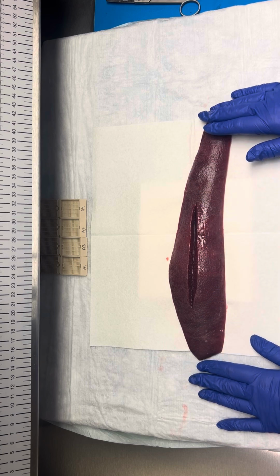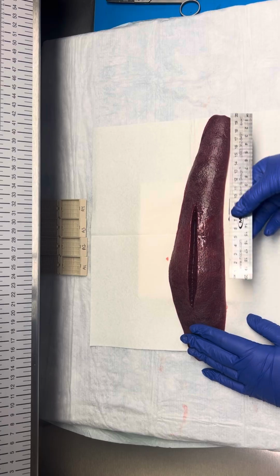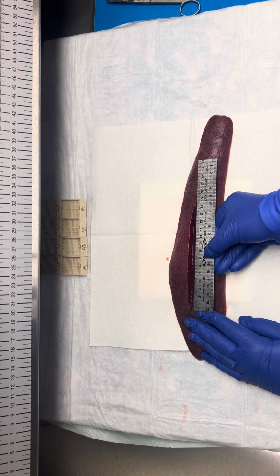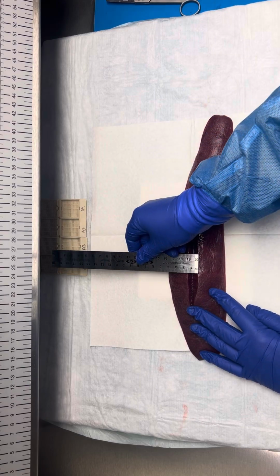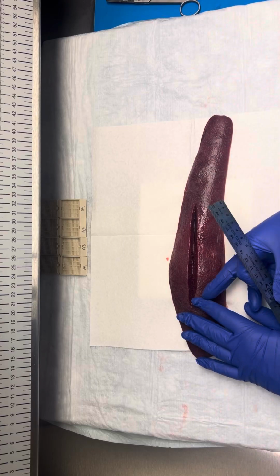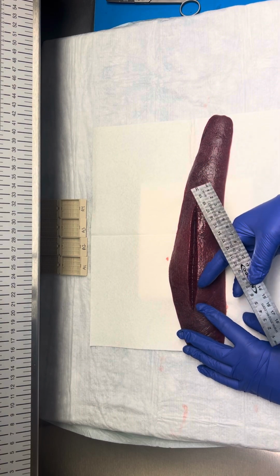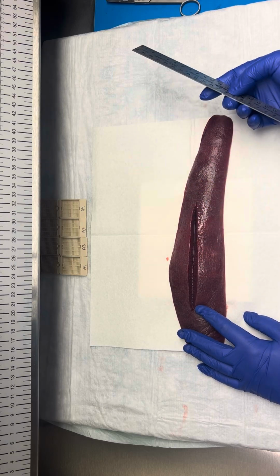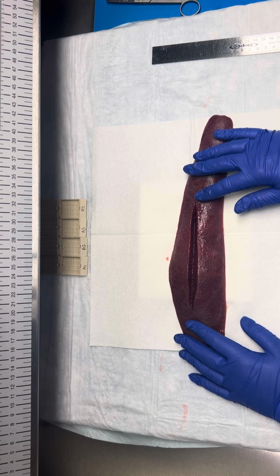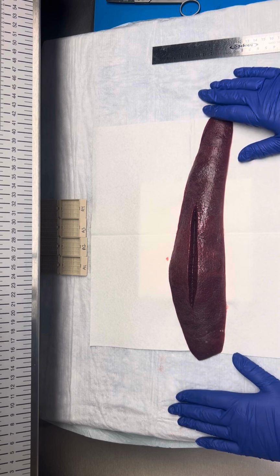So our capsular surface has this laceration. So we'll give a description of our laceration. This laceration will measure in 2D. So it is 14.3 by 1.2 centimeters and is a linear defect with smooth borders. So often in trauma cases, it will be very jagged and irregular. This was made by myself. So it is a very linear laceration.